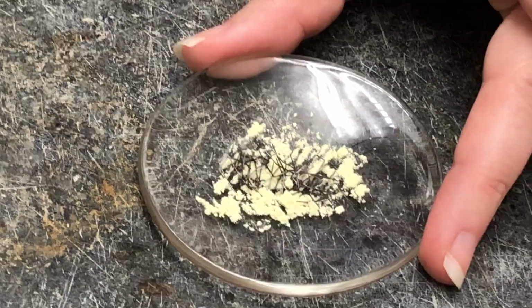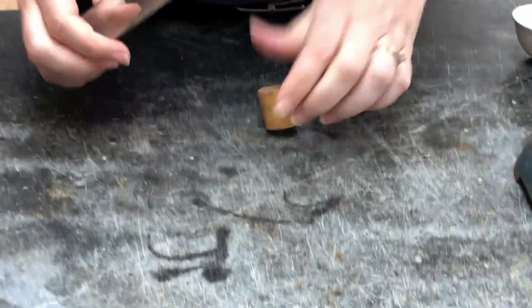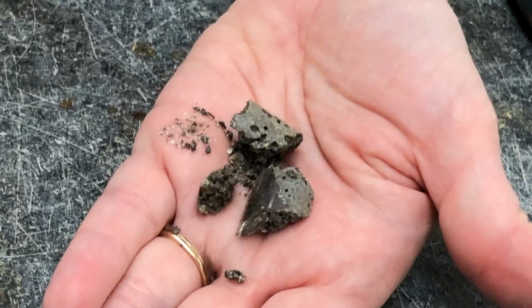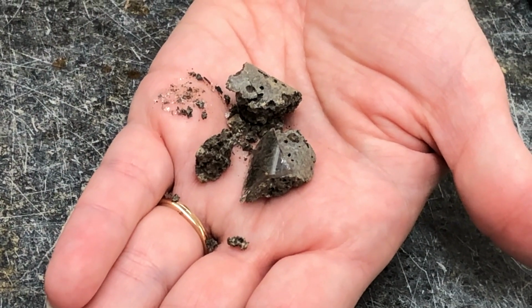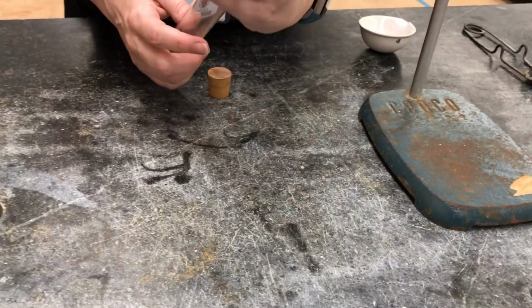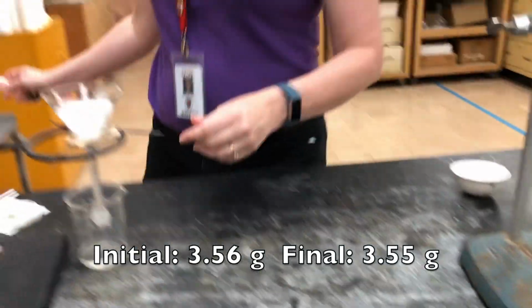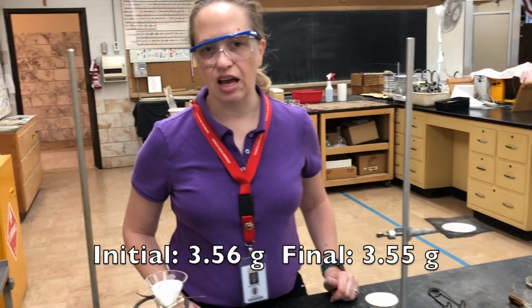Now, if I were to heat this mixture, which I've already done, you get a material that looks like this. On your screen, it will show you what the mass of that mixture was before it was heated and the mass of the product after it was heated.